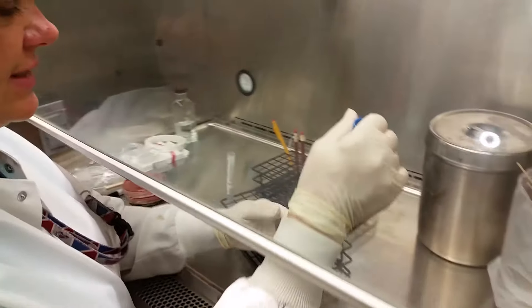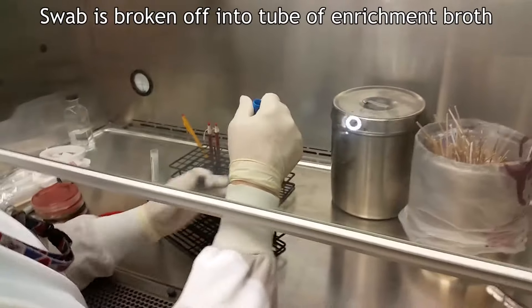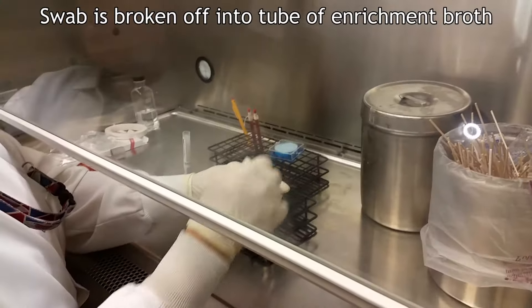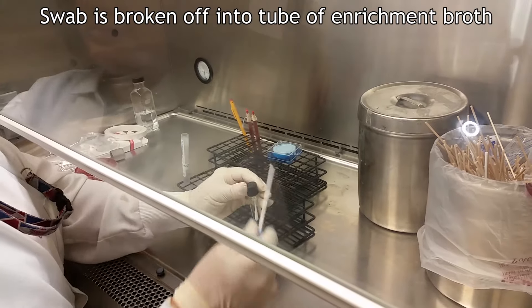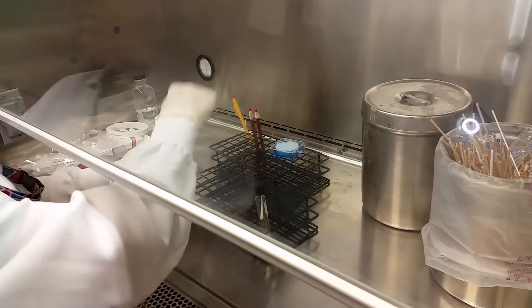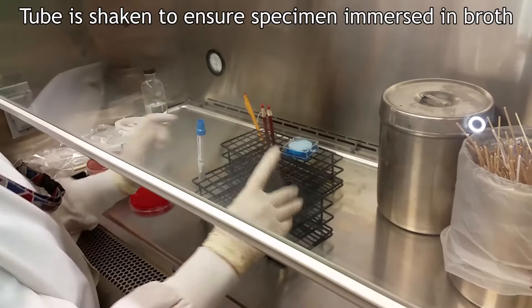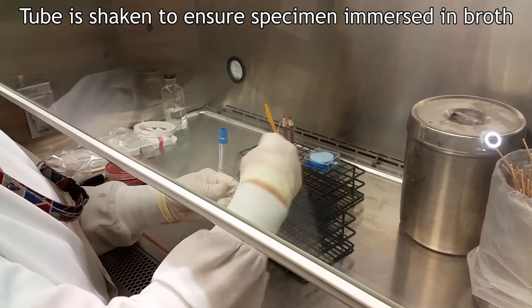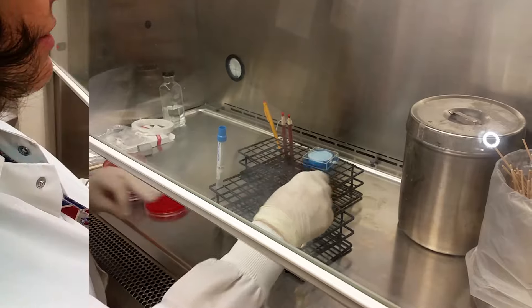After inoculating the plates, the sample swab is broken off into a tube of enrichment media and closed tightly. The tube is shaken so the swab is completely immersed in the enrichment media broth.